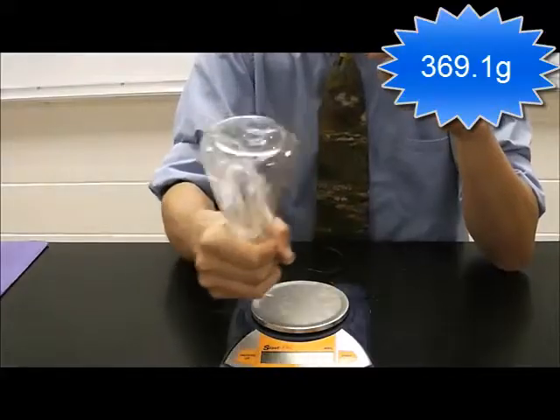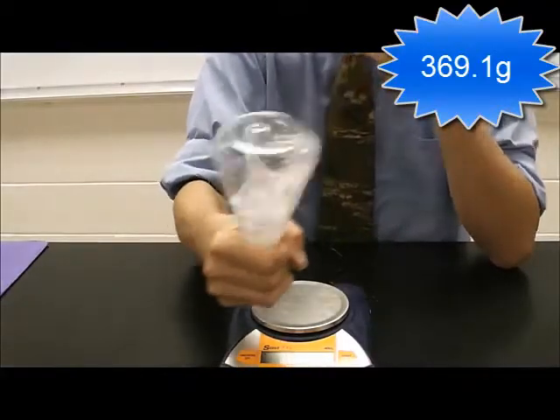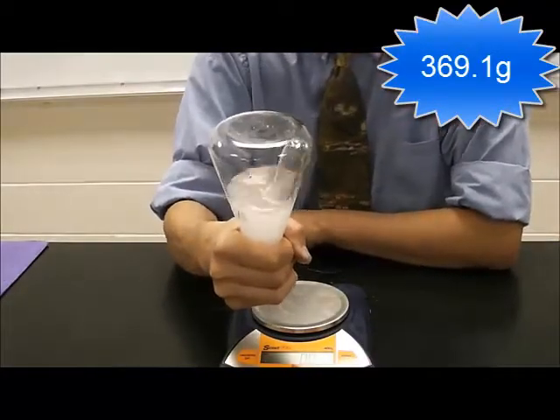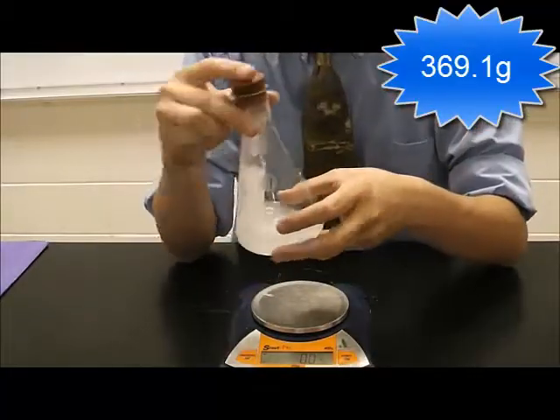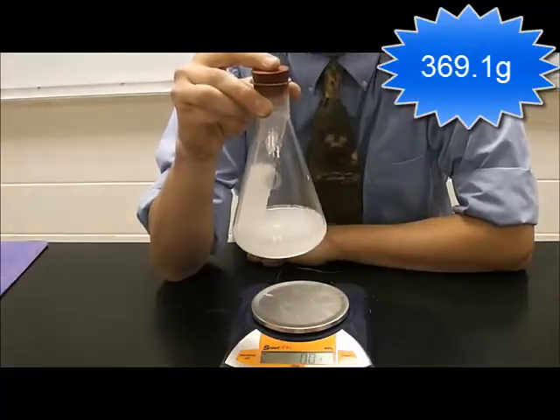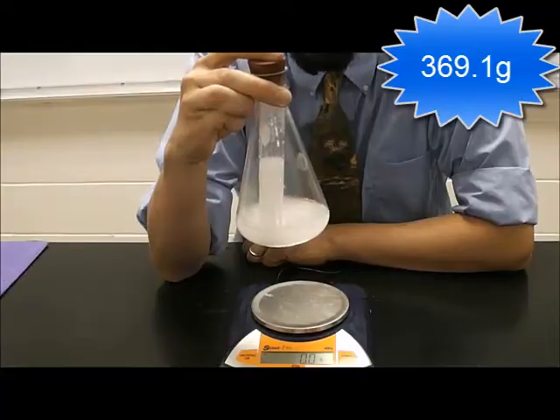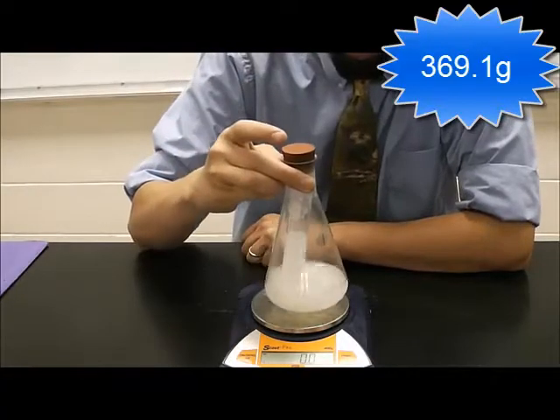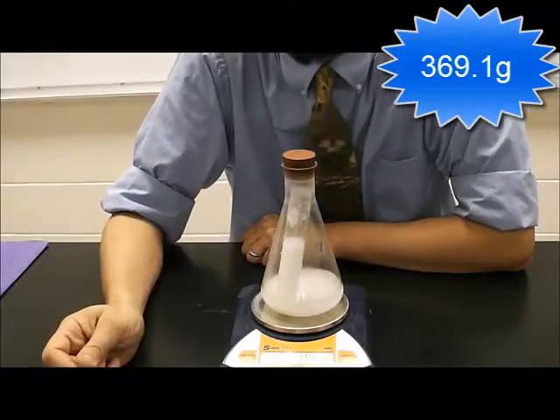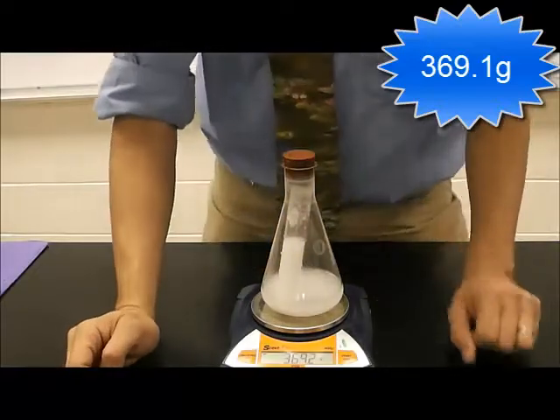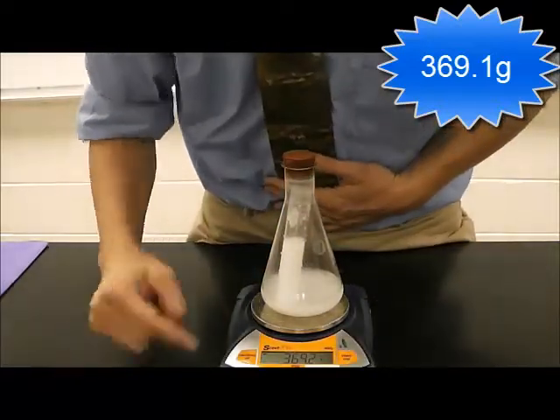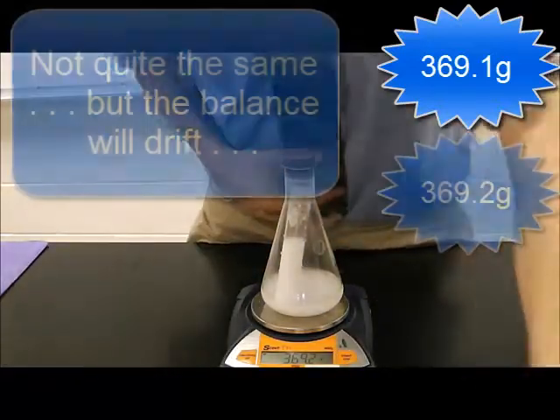Carefully agitate so that the two mixtures, the two solutions actually mix. And you can see there's a pretty startling reaction here. When I place this back on the balance, what you're going to notice is that it's the same mass as before.